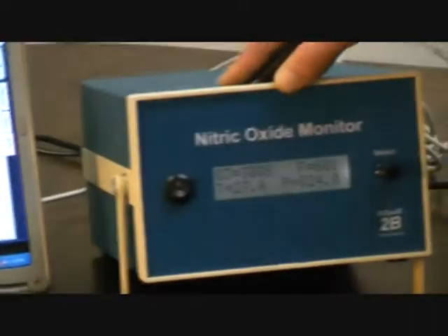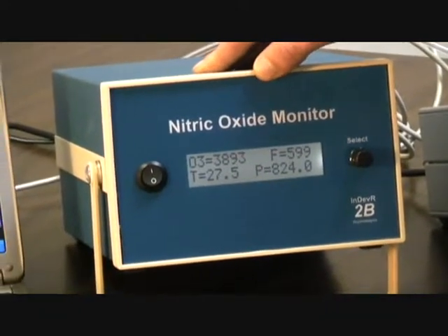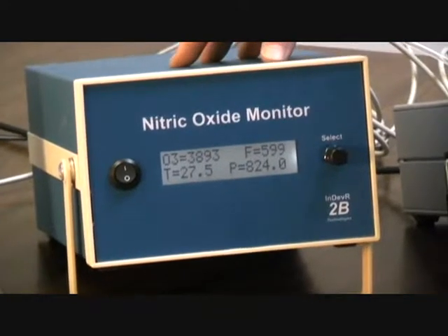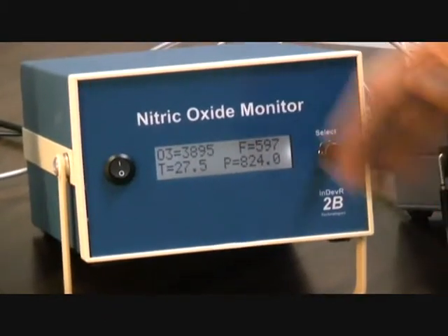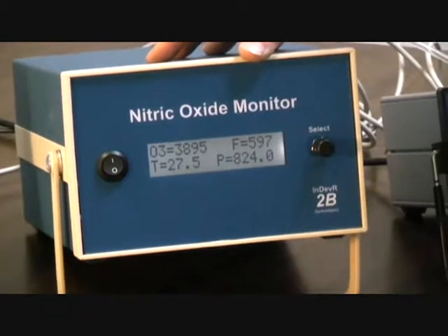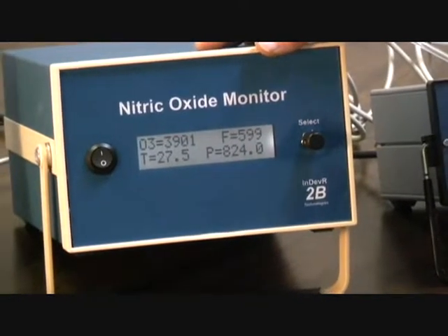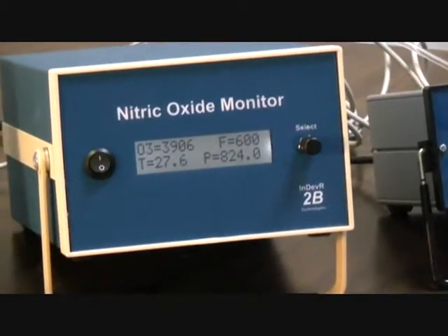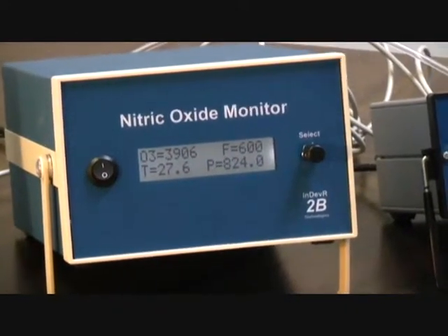Now, typical operation, if this is set to automatic adjustment, it will actually skip out of parameter adjustment mode after 15 measurements of ozone. So what it's doing is it's measuring how much ozone is being produced, which reacts with the sample coming in. That has to be very stable in order for the system to work properly. It also is making sure the flow rate that is going through the reaction coil is very stable, and it makes sure that the ozone flow rate is stable. So if the parameters aren't stable during that mode, then your readings aren't going to be stable during NO mode. And if they're incorrect, then you're not going to get correct readings during NO mode.